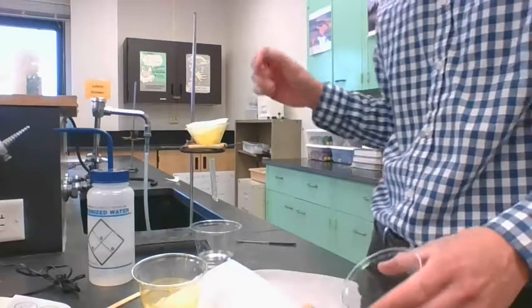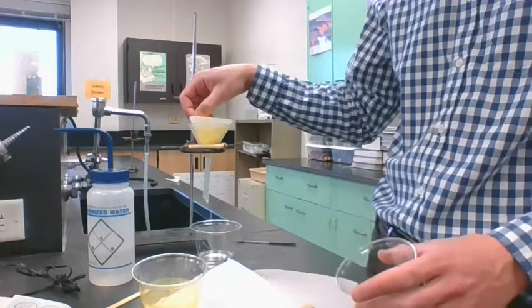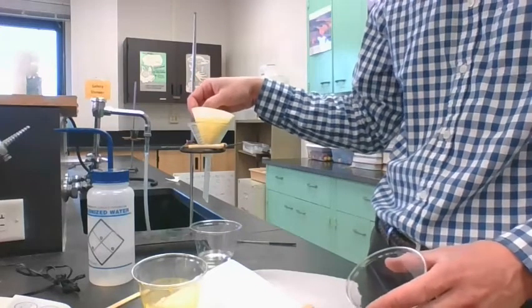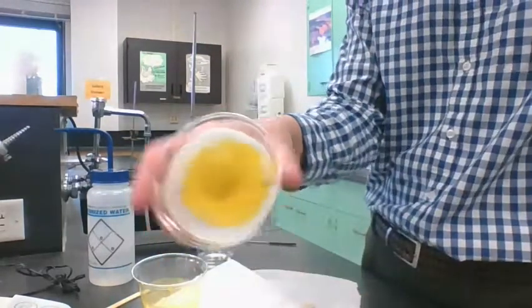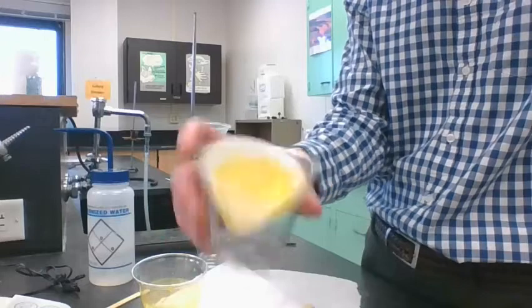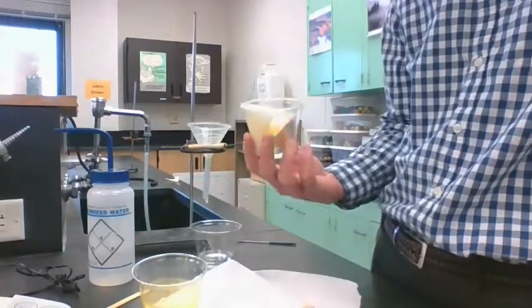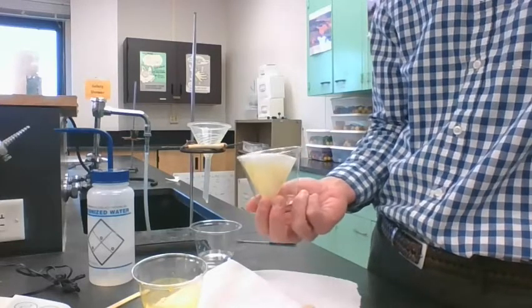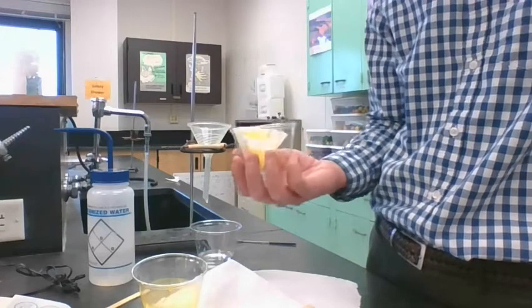So what really needs to happen now is the water on the filter paper needs to dry off. So it's another situation here where we got to give this another day. So I'm going to just transfer it. I put my name on this cup, and we're going to leave that in there. And this is something that we're going to come back and weigh the final product of, for our next period. And we can determine the percent yield from there.